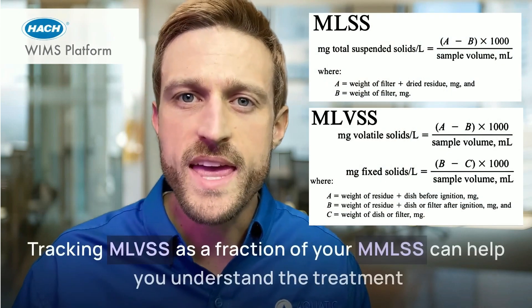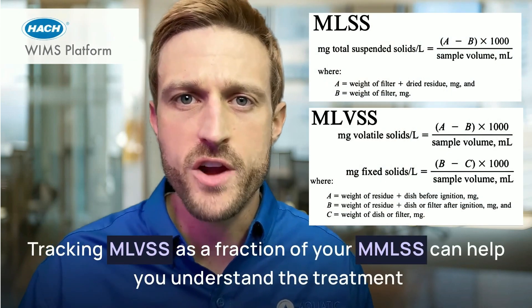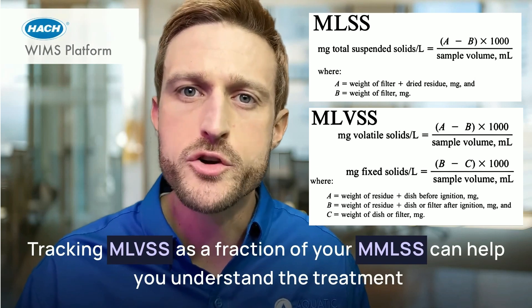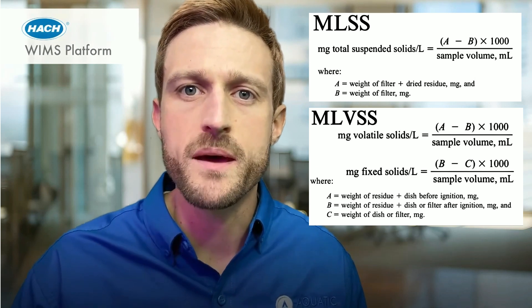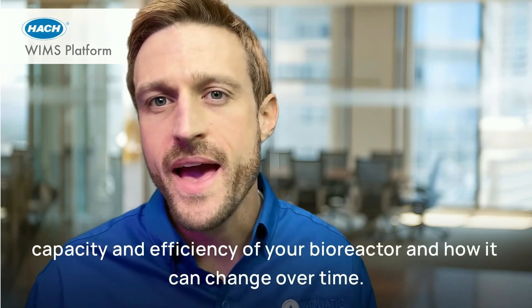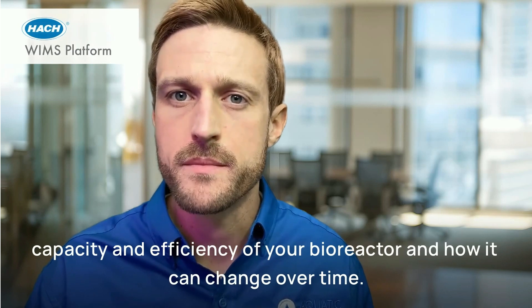Tracking MLVSS as a fraction of your MLSS can help you understand the treatment capacity and efficiency of your bioreactor and how it can change over time.